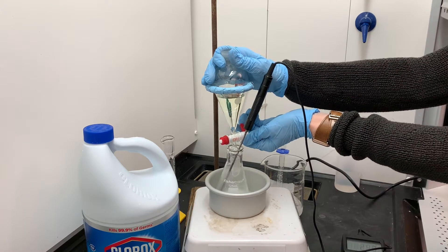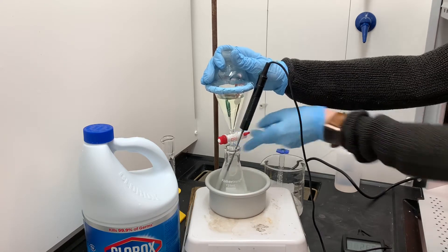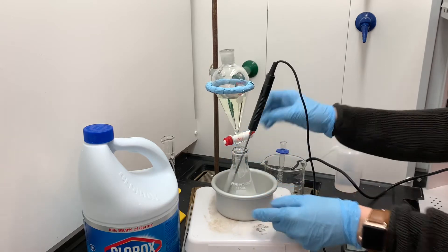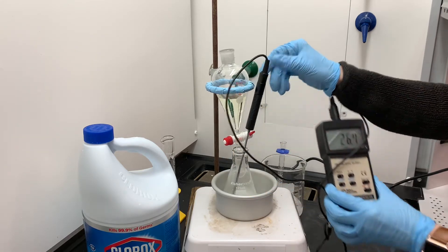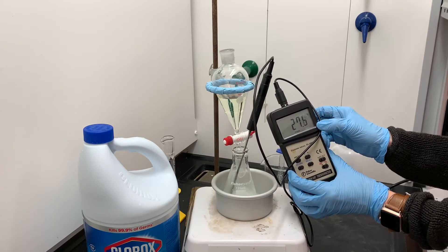After each little addition of bleach, I am going to check the temperature on the thermometer just to make sure that the temperature is not jumping up too quickly. My goal is to keep the temperature below 50 degrees Celsius.